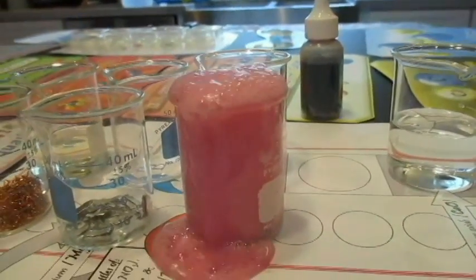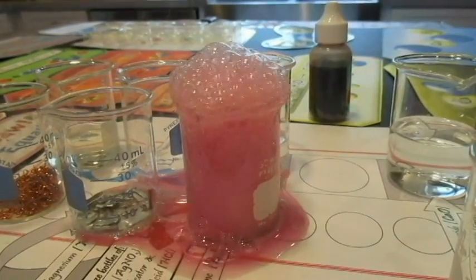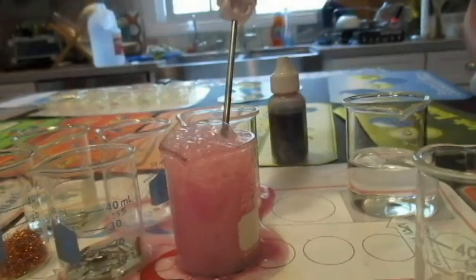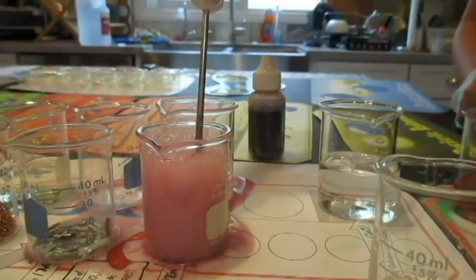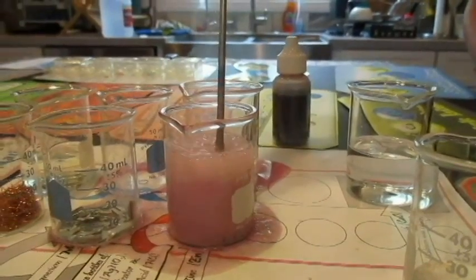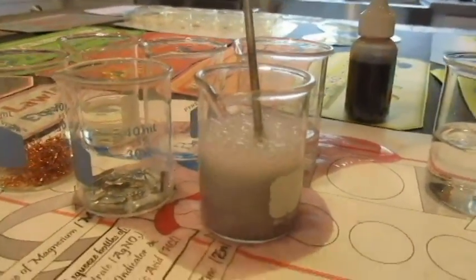That's a good reaction. So I knew this might foam over. I had a suspicion. Now that's a good reaction. Oh, wow. There we go. Get the temperature, Giovanna. The only drawback is this could damage our white background, but if we need to, we'll get white placards. 42.9 Celsius.